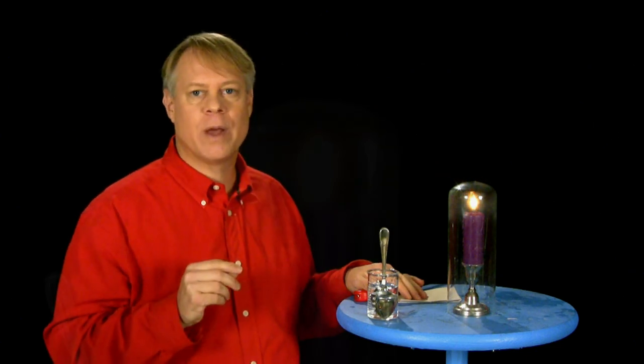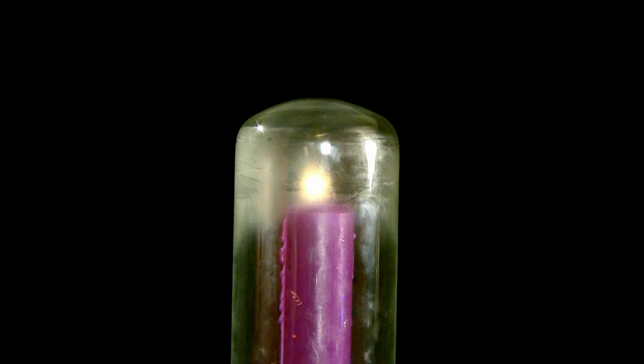This vessel captures all the products of the candle, and you will presently see the vessel's walls become quite opaque. The sides of the jar become cloudy, and the light begins to burn feebly. It is the products you see which make the light so dim, and this is the same thing which makes the sides of the vessel so opaque.